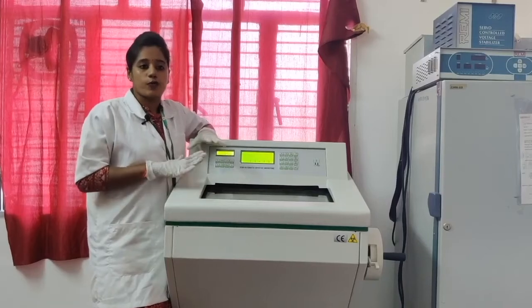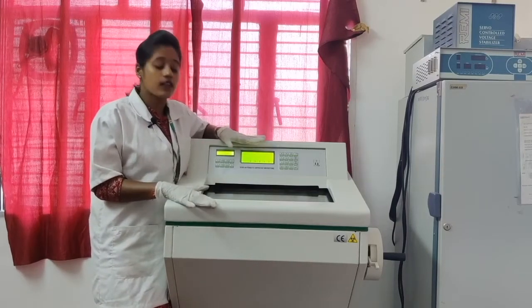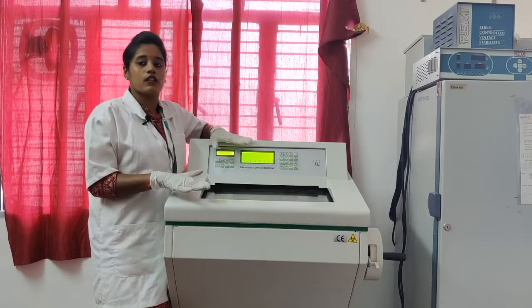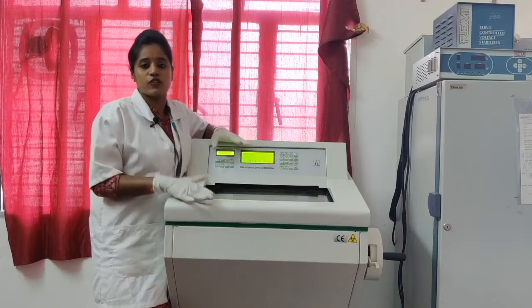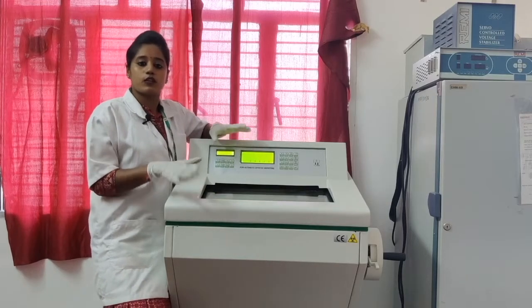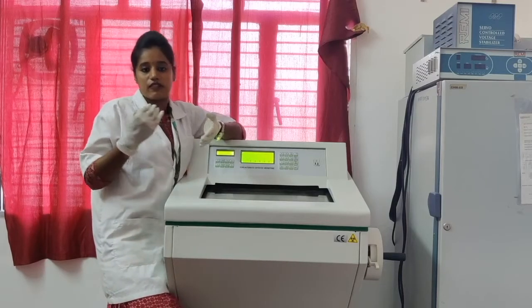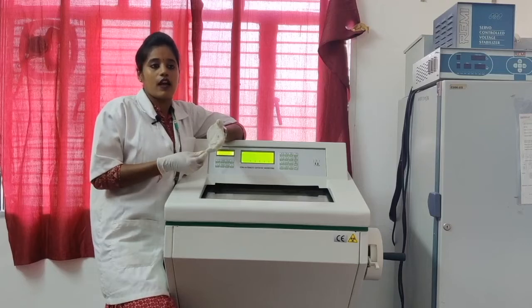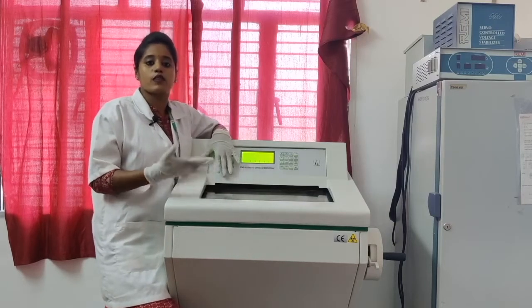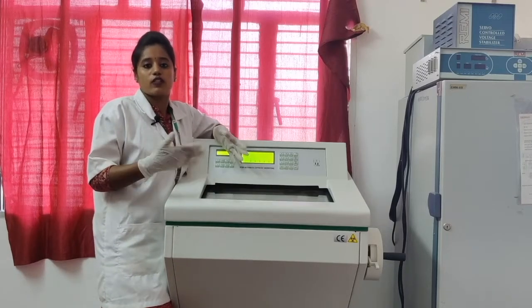Generally in hospitals this device is used for the pathological examination of diseases, but in case of medical research, when we introduce a new drug or some investigational drug, we will give the drug to the animals and we will take or dissect the required part from the animal and cut sections using this device and perform the pathological studies, to see whether the drug gives a positive or a negative result.